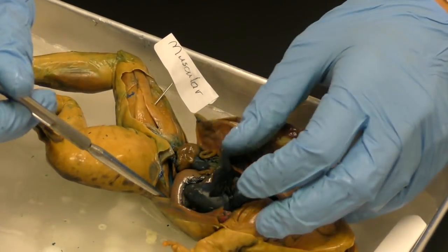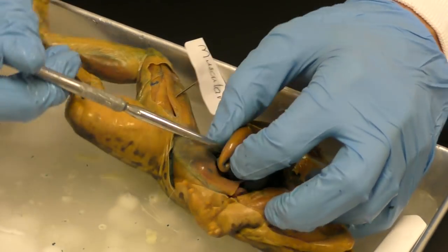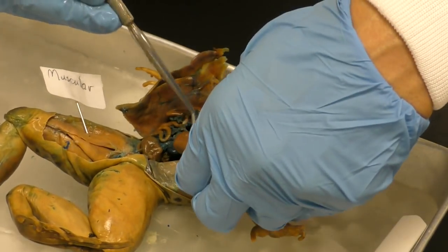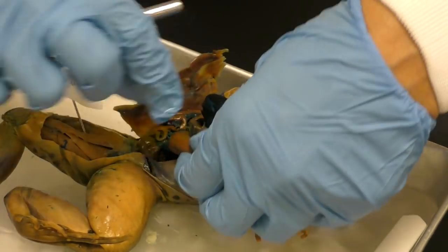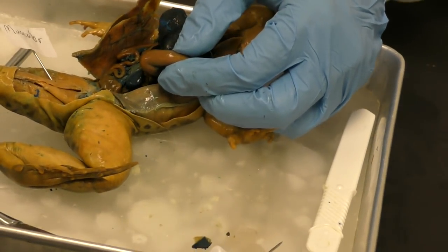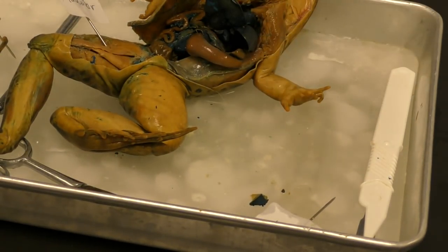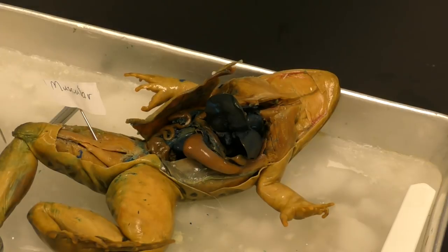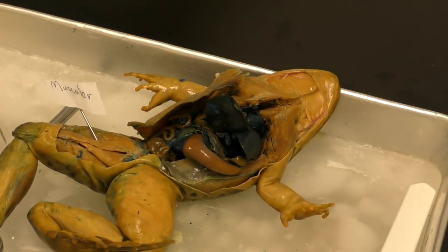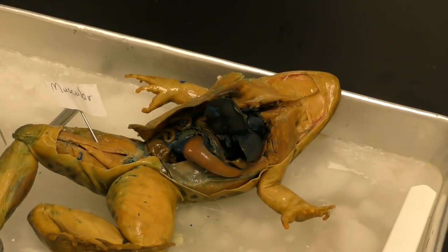One fun thing I like to do is take the stomach out. And I think I told you what the name of the system was called when I was talking. So go ahead, we'll name that system. And guess what? I did not make a tag for it. So I'm going to take my gloves off. And I hope that you called it the digestive system because it digests the food.